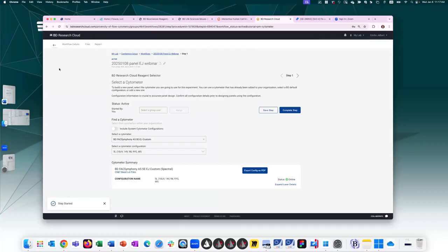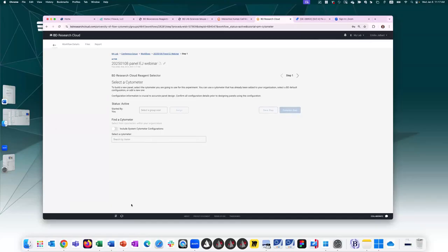So the first step in panel creation is selecting a cytometer. By default, it selects the last cytometer I used. But if this is the first time you're on this page, this is what it will look like. By clicking in the select a cytometer box, it brings up the cytometers that you have uploaded in that My Cytometer section. If you want to see the additional cytometers that have been uploaded into BDRC, so the BD default cytometers, I can add those into the drop-down list, or I can keep those out and only have the ones that are available to me.